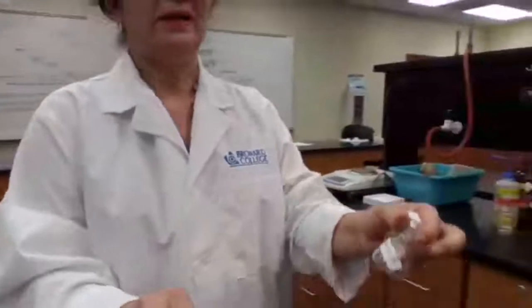For unknown A, we need the 5 milliliters of the unknown solution.